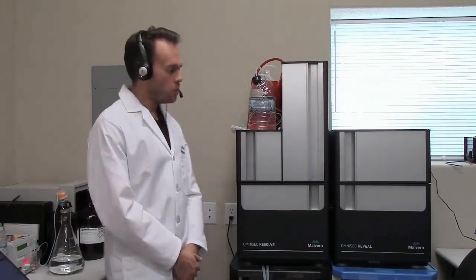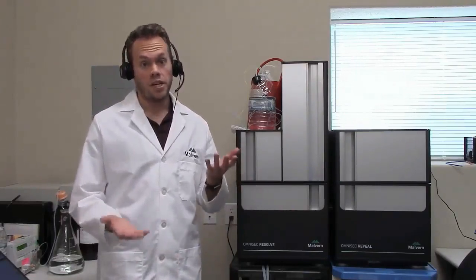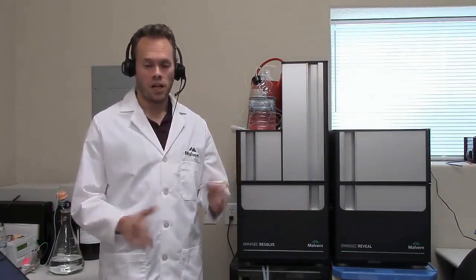So now we're in pure water, we're ready to switch to THF, and the process is going to be exactly the same. This time though, the viscosity difference between the water and the THF is far greater, and so I can't run at a mil per minute when I exchange my mobile phases. I've got to run slower. So I'm going to run at half a mil per minute to do this, and we'll see how that looks.